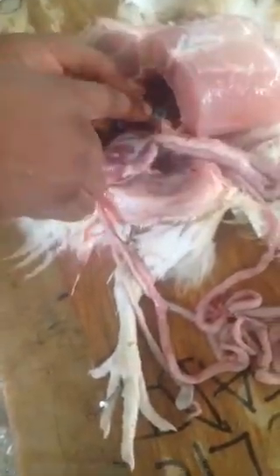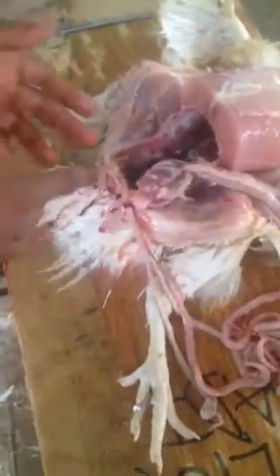It produces what? We have the liver. We have what here? The gallbladder. It is conspicuously showing, the gallbladder. Everything here is showing. This is the digestive system. We have the caecum that stores feces temporarily. From the caecum, we have the diverticuli. Our diverticuli is here, very conspicuous.